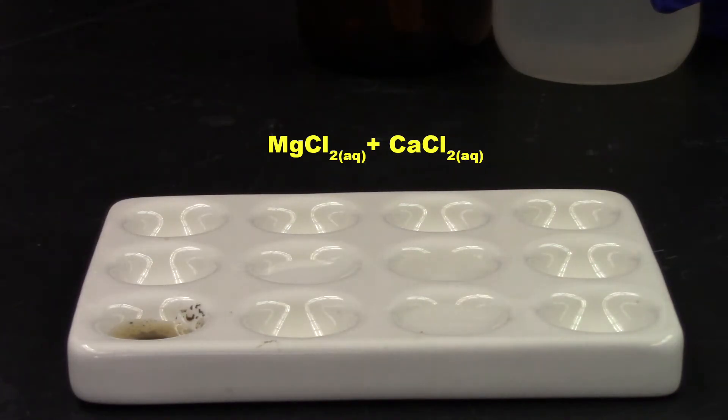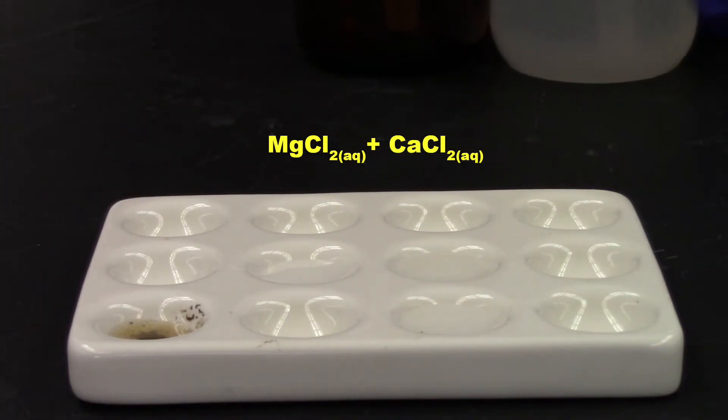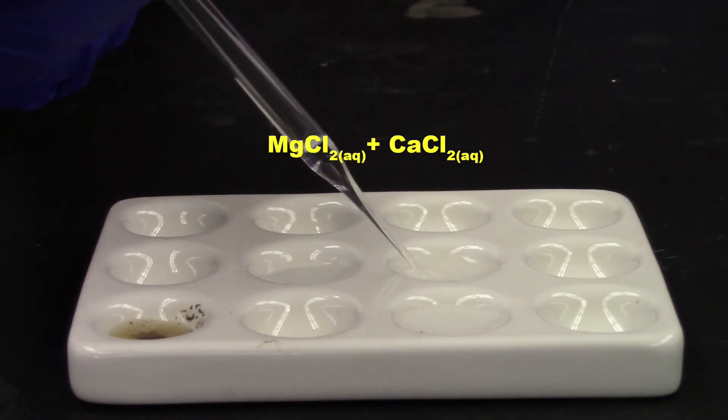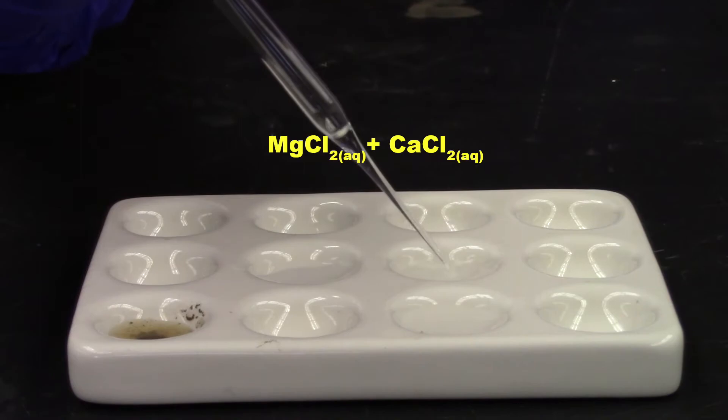All right. Again, it appears like nothing's happened. Let's take a closer look. Never take it for granted. Ah, clear, colorless. So it looks like nothing did happen in this reaction.